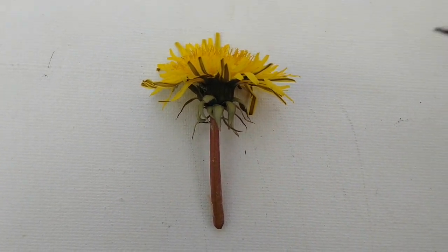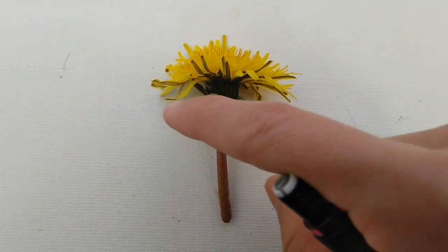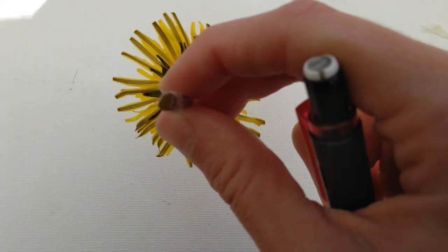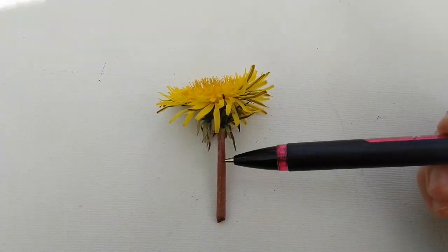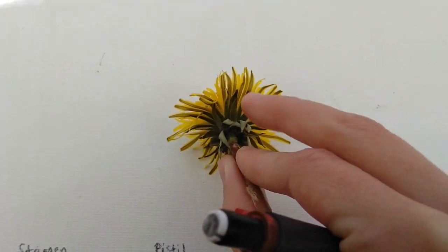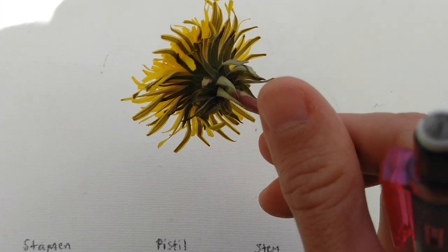Let's start with the outside. Does it have a stem? Yeah, it's got this stem right here. Dandelion stems are kind of fun because they're hollow. So you look on the inside and there's like a little hole. It's like a straw. So this dandelion does have a stem. And look, it's got some protective sepals down here, these little coils of leaves that used to protect the bud before it opened up. So it does have some sepals right down there.